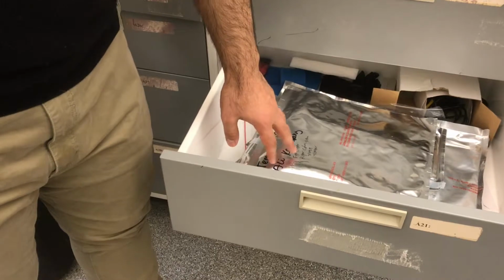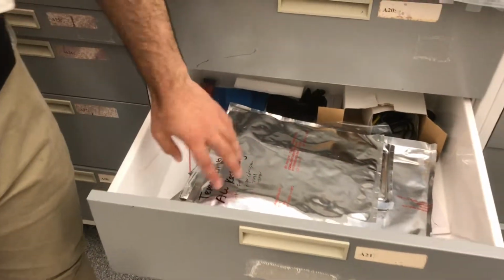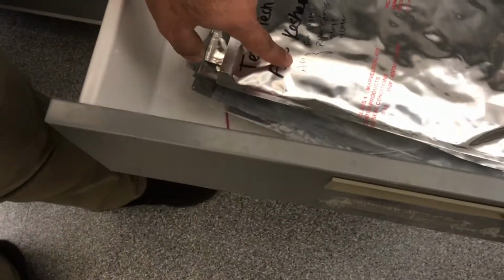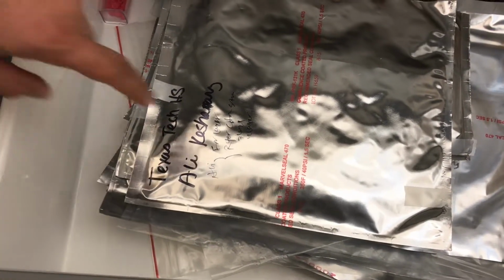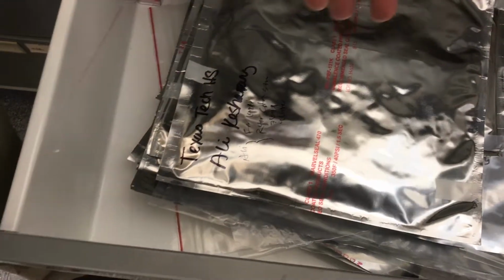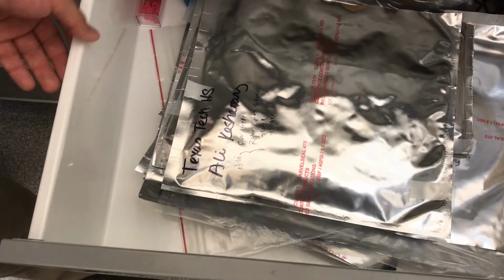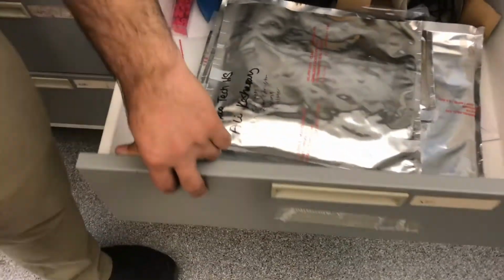This is the photo mask you receive from the company, CAD Art. When you receive a photo mask, you should note three things: the name of the person who ordered it, the structure of the photo mask, and the date that you received it. The person who ordered or drew it should be labeled on it.